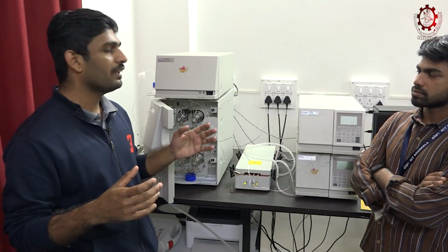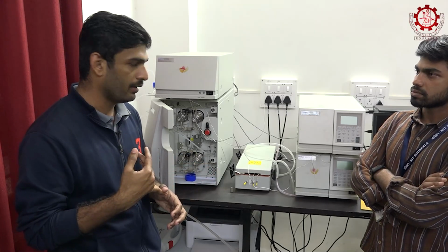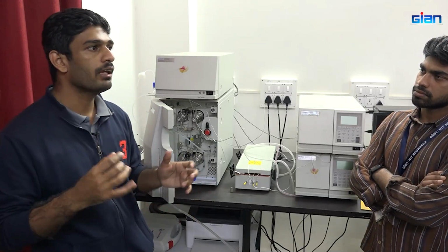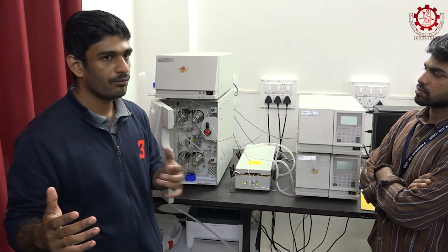Sample preparation procedure: for example, we require a highly pure sample to be injected. For that we will be using deionized water. First of all, deionized water is required, and the concentration should be standardized. For example, if our standard has 50 mg per ml, the sample should also be in the near range. Like if it is 50, then even 5 to 100.